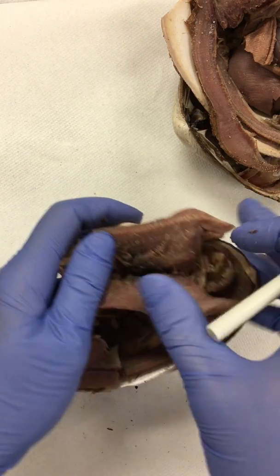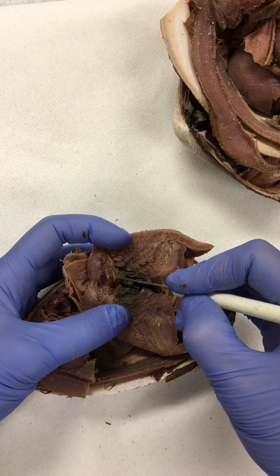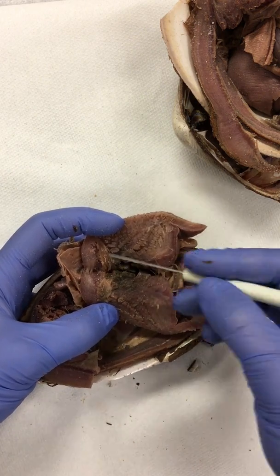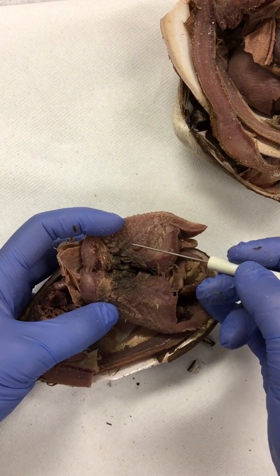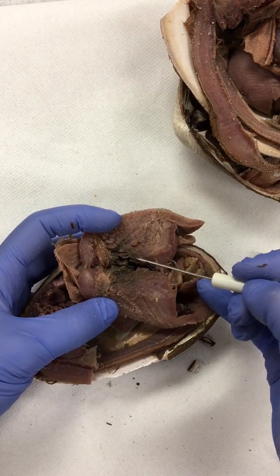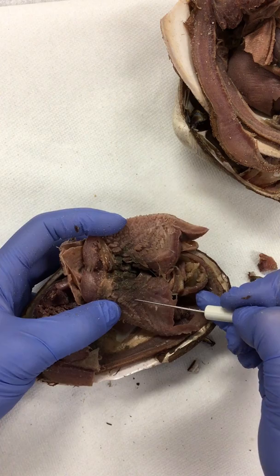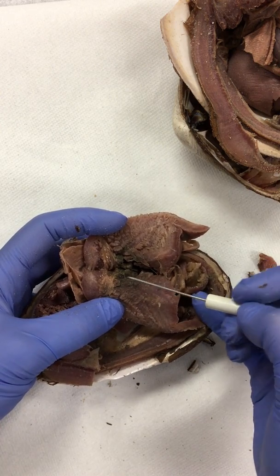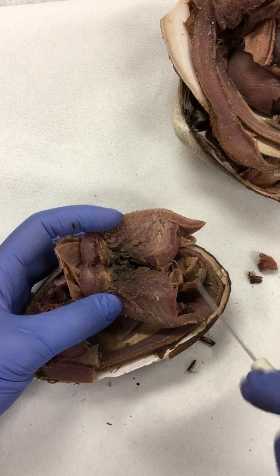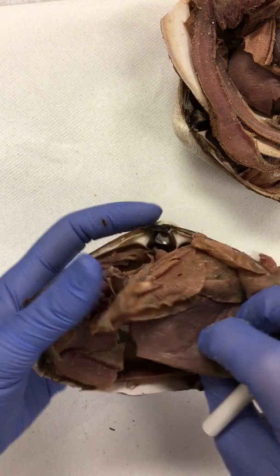When we open it up, again, we can see things like the intestines. This region would be the intestinal region. And usually in this area you also see gonads. The gonads will be a cream color. Unfortunately, neither this clam nor the other clam that we're looking at has any gonads, so they're not ready for reproduction, but you would find them in this area. If you look at the other video, you'll be able to see them in it. Also note that the other video doesn't clearly show the siphons like I'm showing you in this one, so please note that as you're studying.